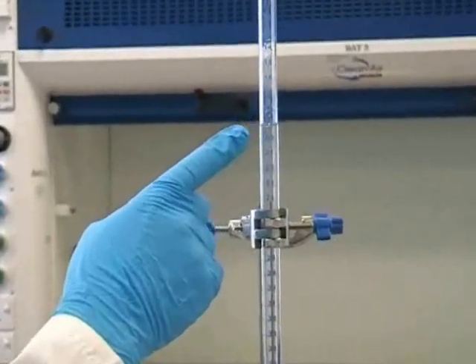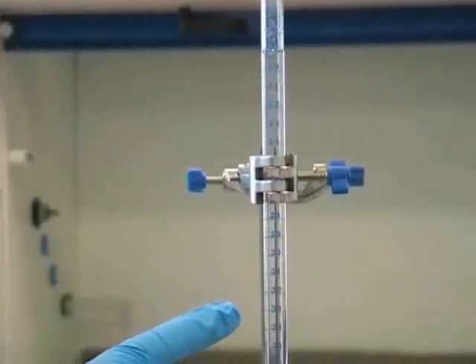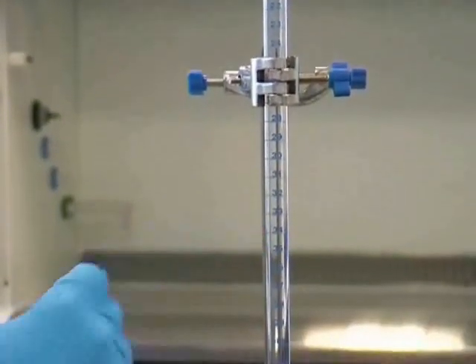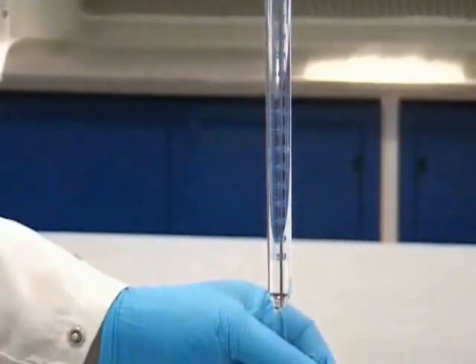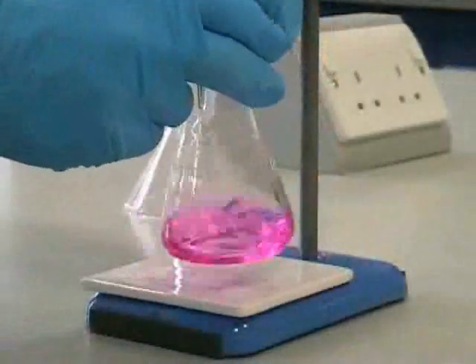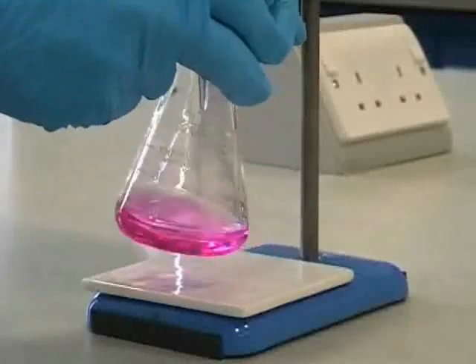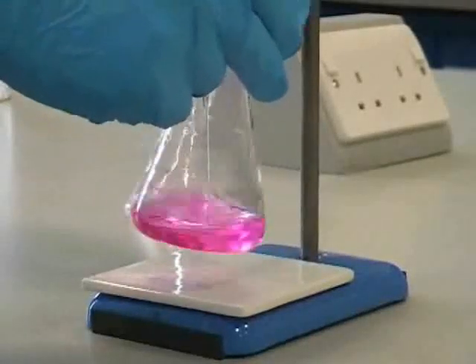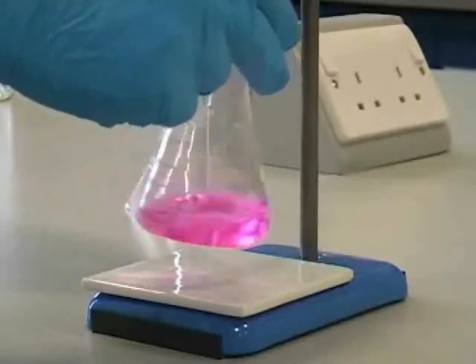So we're going to add about 14cm³ by going very quickly from 19cm³ to 33cm³ on the burette. Here you can see the solution running in quickly.